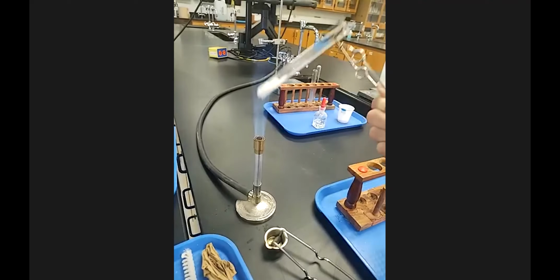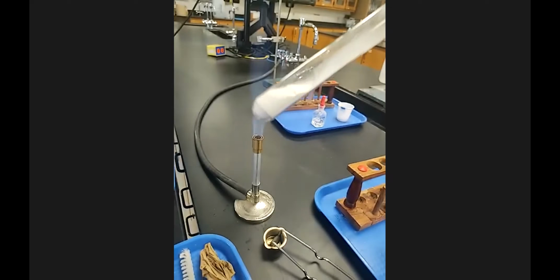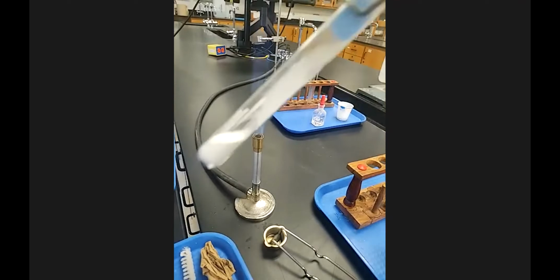If you're making observations, you don't want to heat something for very long before you pull it out and view it, and it looks like it's alive. Okay, it's not alive, but it looks like it's alive. And then make your observation. So this is definitely the during.